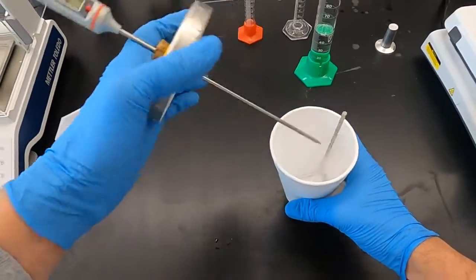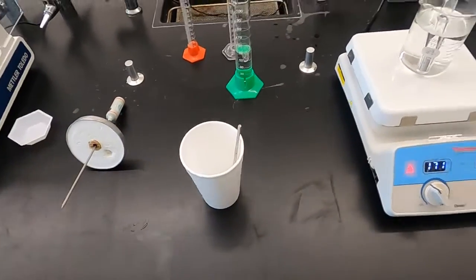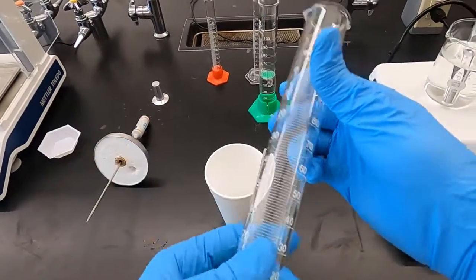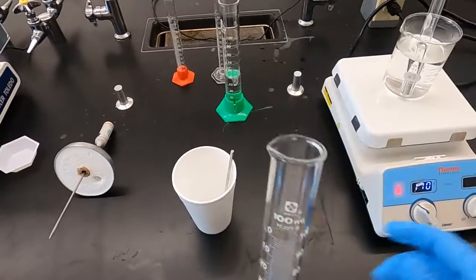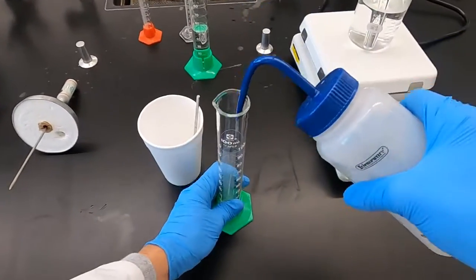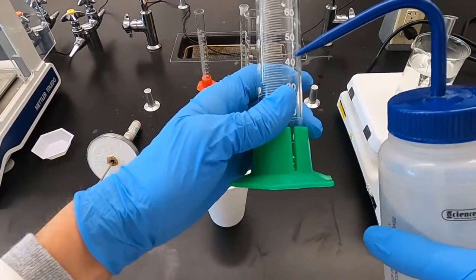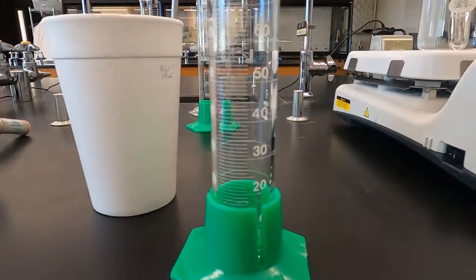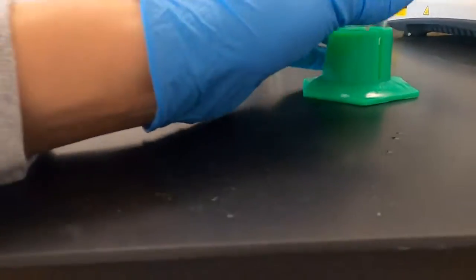So, no water in here yet. We're going to pour out 50 milliliters of deionized water. Now, if you are in the lab, you would get a clean graduated cylinder. Note where the 50 milliliter line is, and we would get at eye level, get some deionized water, pour this in until we slowly get to 50. And once you start getting close, you get down, you're going to be eye level with this and see where the 50 lines up with the bottom meniscus.